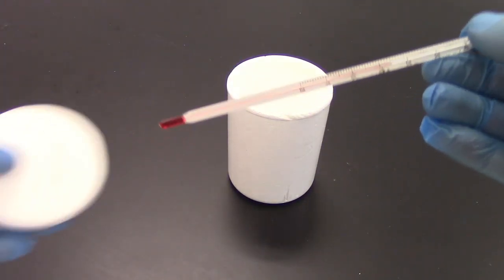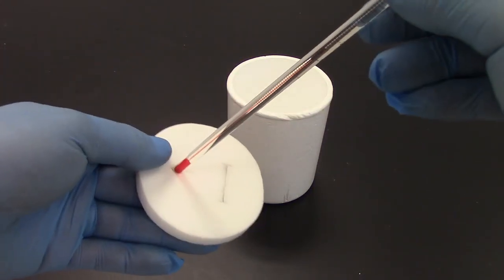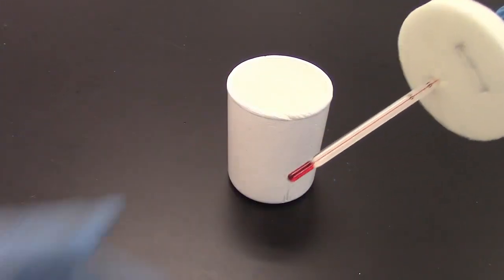Next, I'm going to take my calorimeter and I'm going to take the thermometer and I'm going to push it through the lid. Makes a cool sound. So it's sticking out just like that.